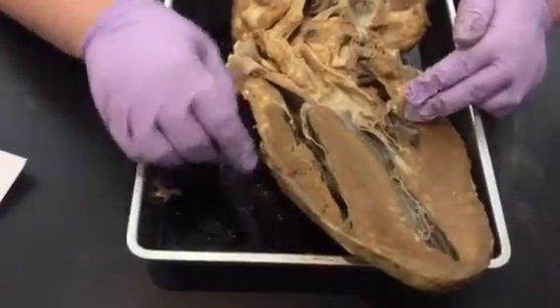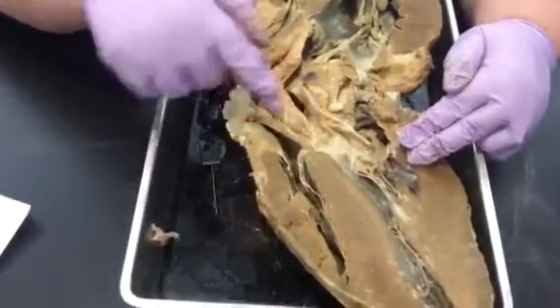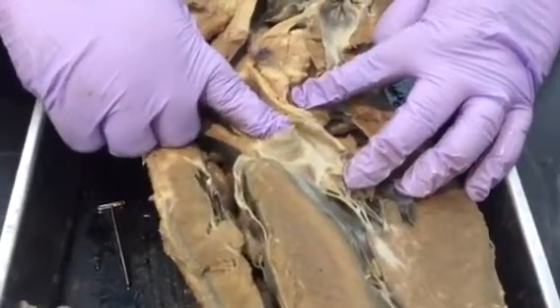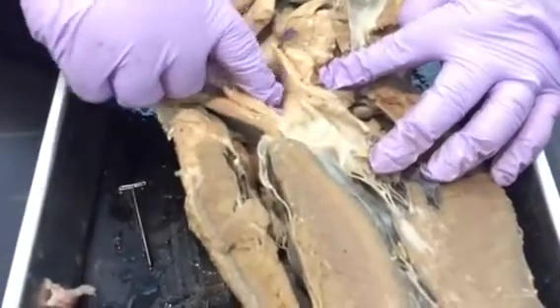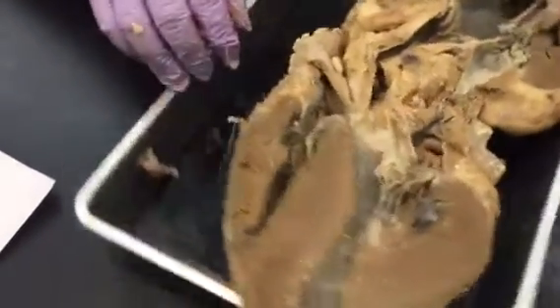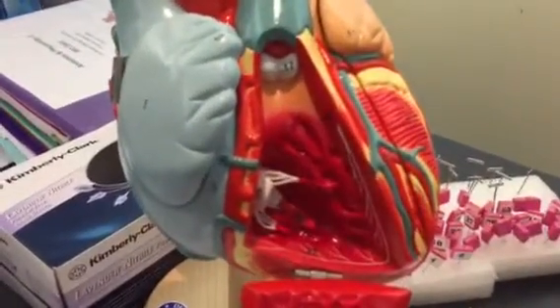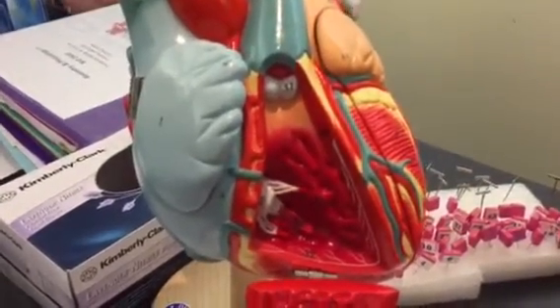Coming out of the left ventricle is the aorta — this would be the opening for the aorta. The aorta has a little semilunar valve that looks like a fleshy valve: this is the aortic semilunar valve. And if you get deep inside, you can see the pulmonary semilunar valve going to the pulmonary trunk. It's this little white valve — looks like a lunar butt, that's how I make that association.